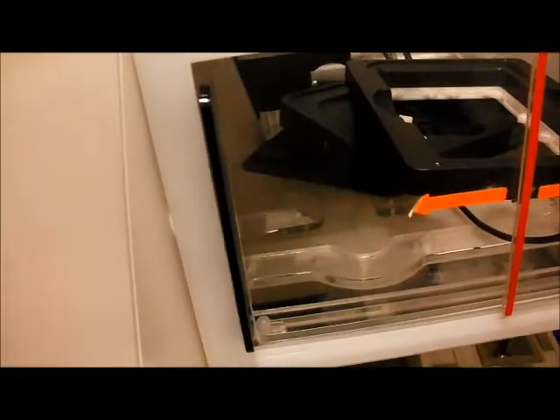So let's see if this works. I've tried this before. Okay, there's some sort of cells here, take my word for it. Go a little bit nearer. Anyway, so I look down the eyepiece, and this is a run which was previously run, so there won't be the scratch on this wound healing assay, but normally you would see some sort of scratch.